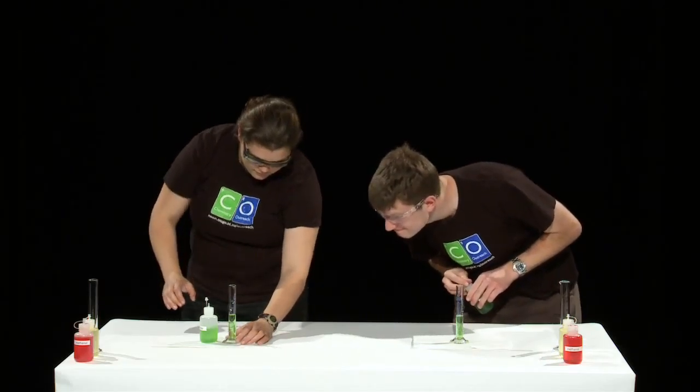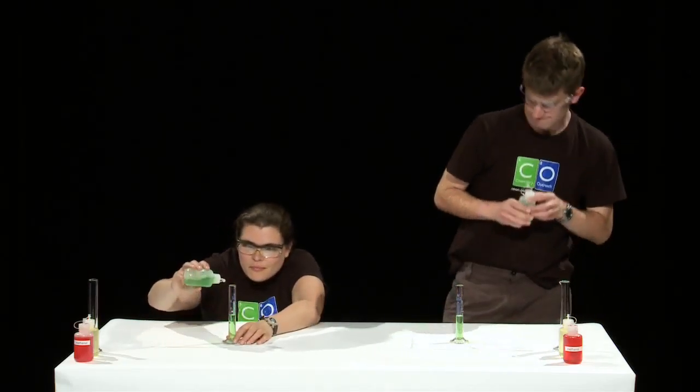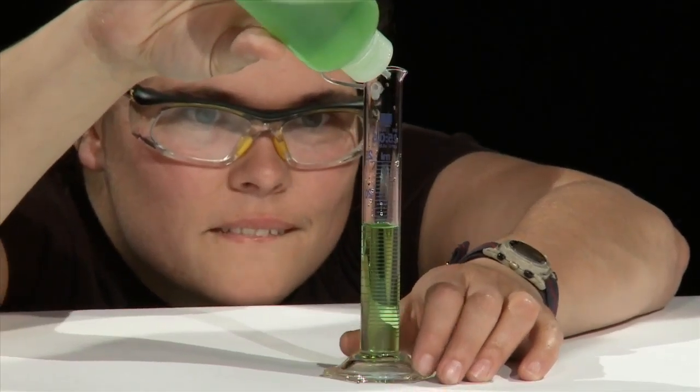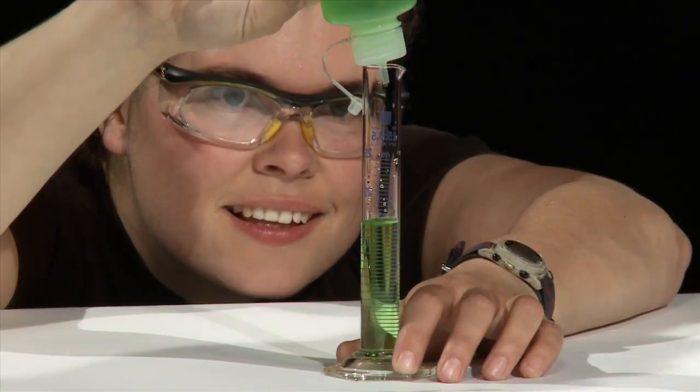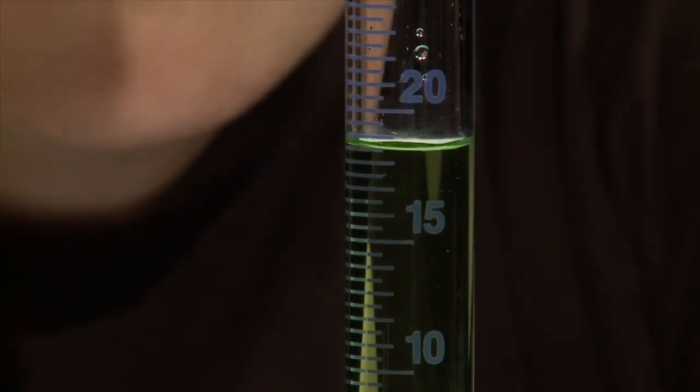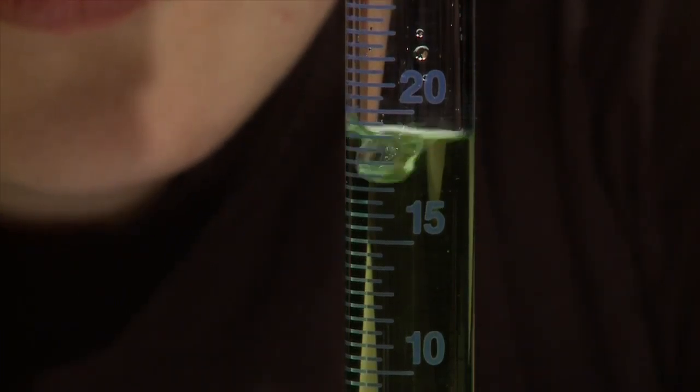When you get near the line of 20 milliliters, get down so that your eye level is on the level of the 20 milliliter line. Now add the last few drops very slowly.